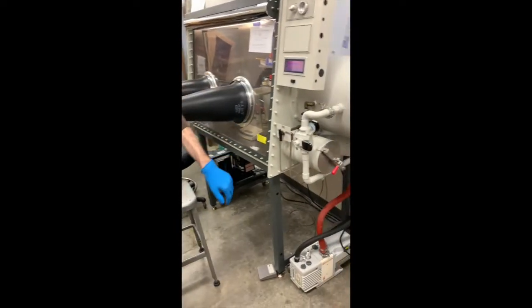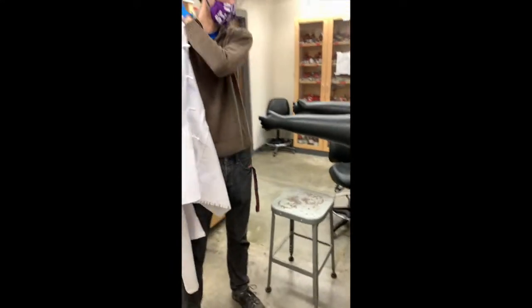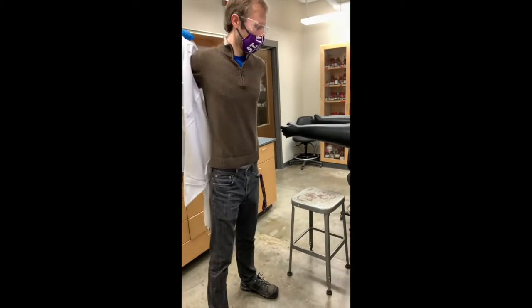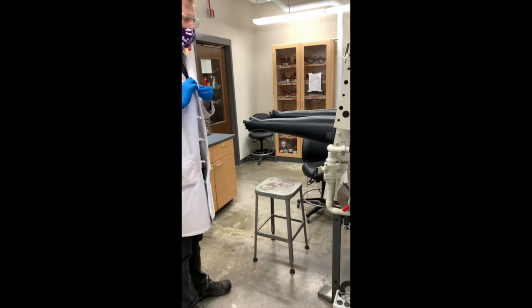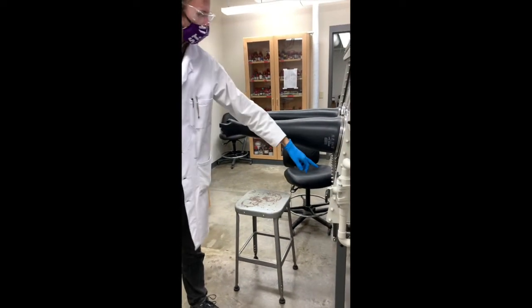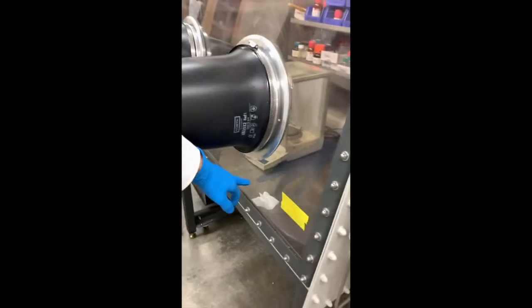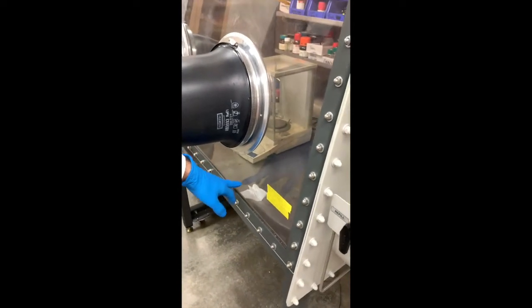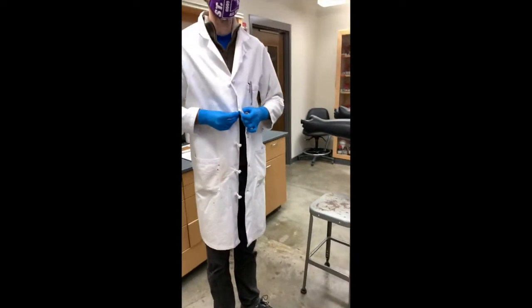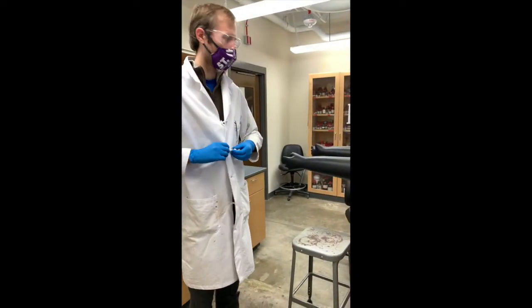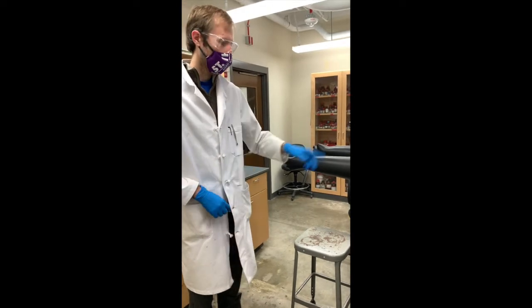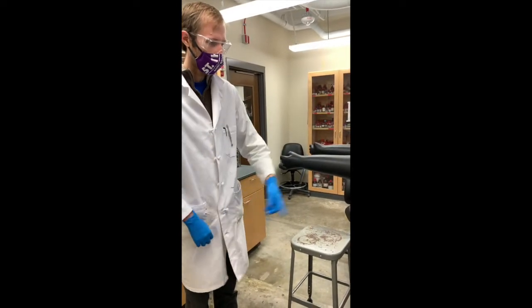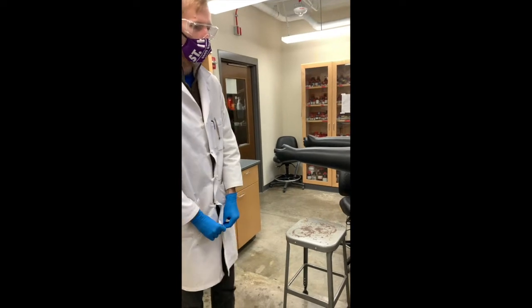And I'm ready to grab my thing. Now it's a good idea to put that lab coat back on because now you're going to be dealing with some chemicals. And I just realized I forgot something. So I'm going to get this later, I promise. But you do not want to forget the Kim Wipe that you used to wipe the balance and spatula. You want to try to avoid leaving trash behind for the next user. So I'll come back in and grab that in just a second. But right now I need to get this chemical out and manage my reaction.